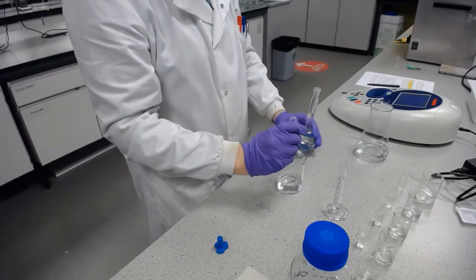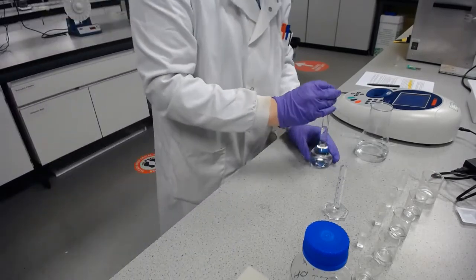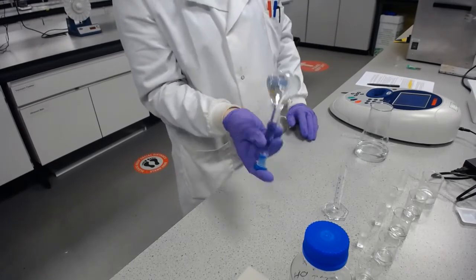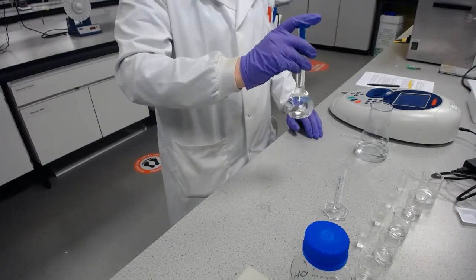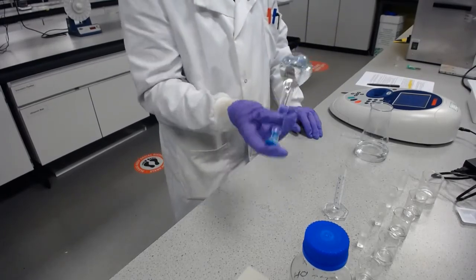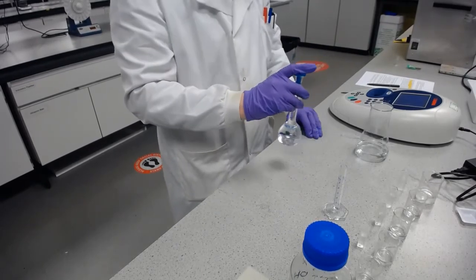Just using a pipette to get up to the line to make sure that it's nice and accurately at 100 millilitres. Now, before you do anything with this sample, we must mix, particularly in a volumetric flask, because the stuff in the neck is unlikely to have diffused in the time it takes you to pour in up to the volume. They're not designed for diffusion, they're designed for precision. So we make sure that's nice and mixed.